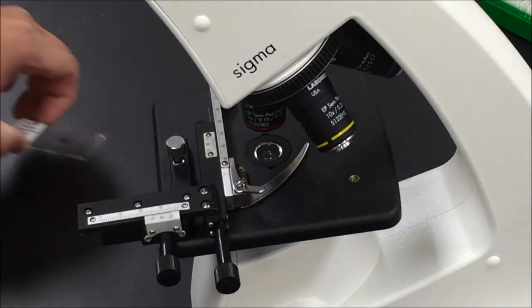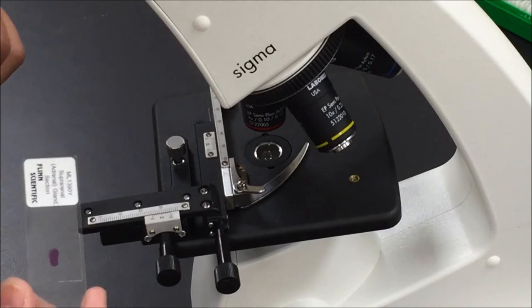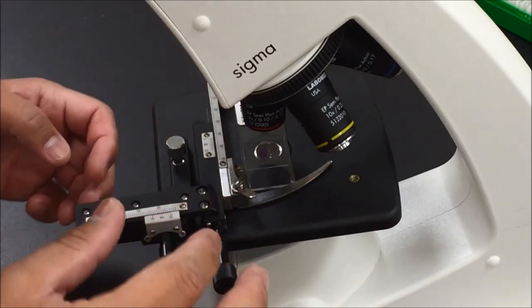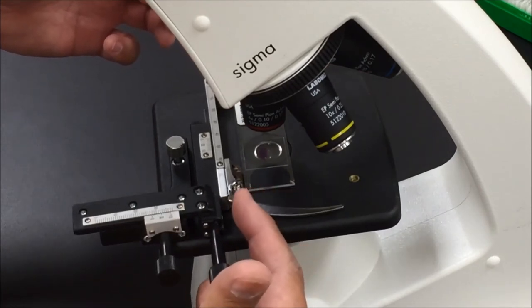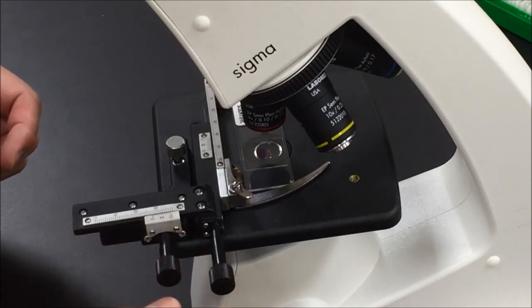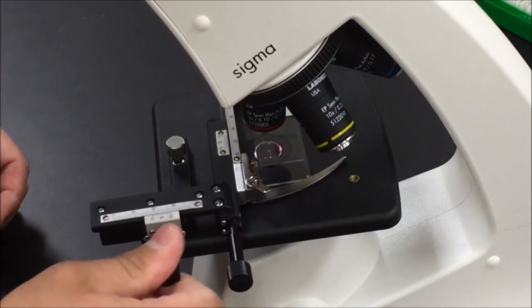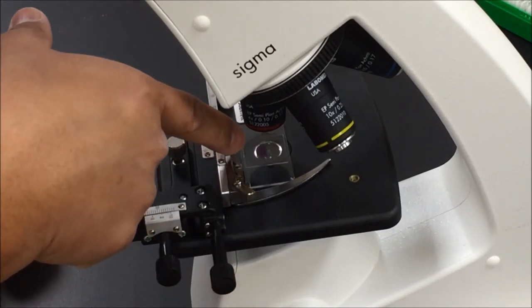When you're ready to begin looking for specimens, always begin your search under low power. Obtain your slide, place it onto the stage, and secure it with this clip. You'll have to use this handle to place your slide. There are two knobs associated with finding your specimen: one knob controls left and right, the other controls up and back. Use these two knobs to center your specimen in your field.